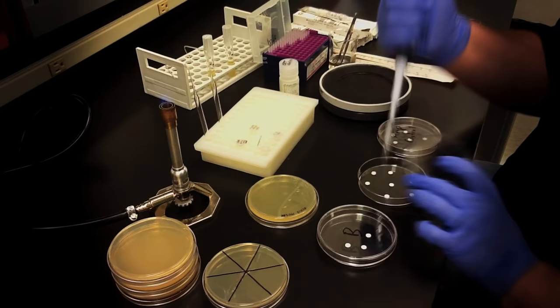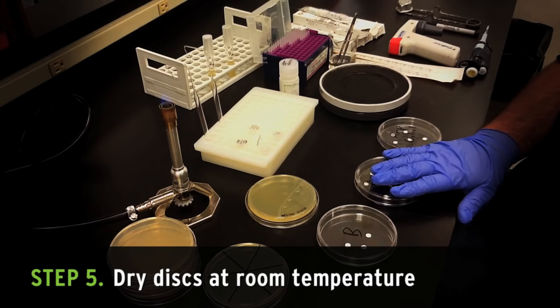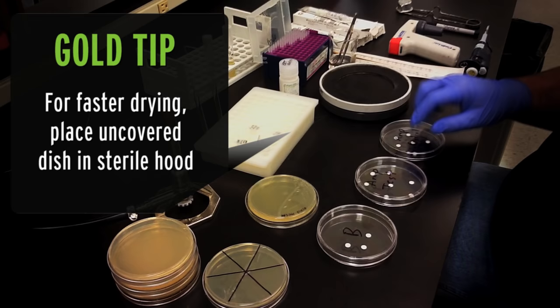After the solution has been added, let the disc dry. This can be done covered at room temp on the bench, and it can take up to three hours. For faster drying, I leave my dishes open in a laminar flow hood, which will dry the discs in as little as 30 minutes.